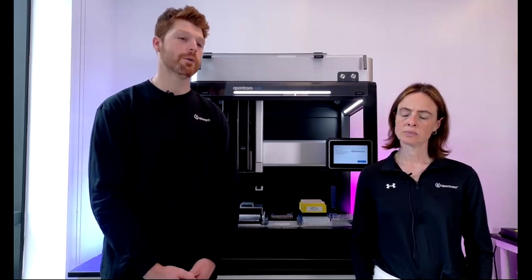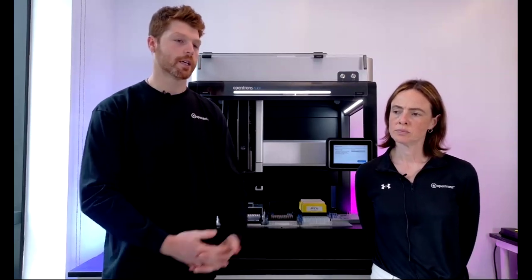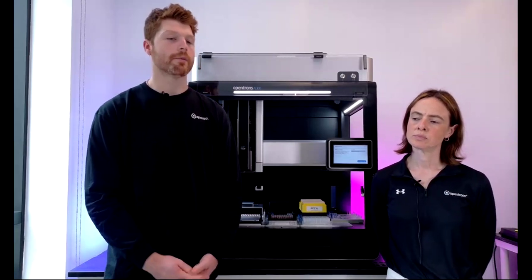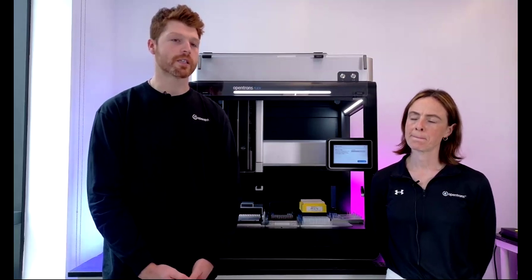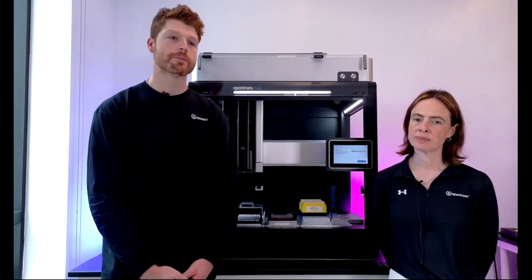Great. For lower volume applications, does the pipette touch the bottom to ensure complete transfer? You can definitely have it written out in that way. We have command sets that allow you to control the Z height, as well as, Fran had mentioned before, the XY definition for where you are pipetting to. As long as the labware is defined correctly, which it should be if it's taken from our labware library, or if you create your own custom definition of it, then yeah, a contact dispense mode is definitely something that you can enable, whether that's to the plate bottom or to the liquid in the well. Great. Thanks, Nick.